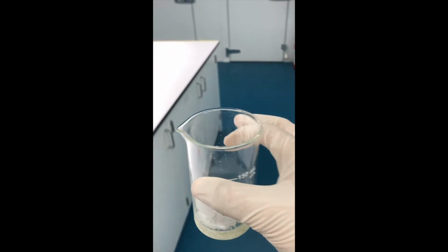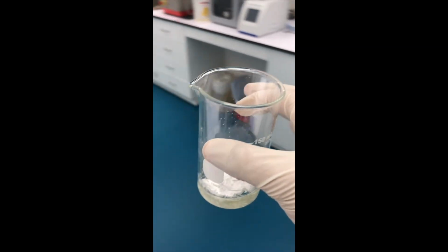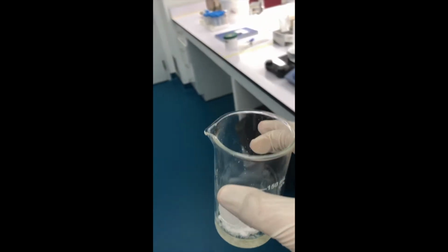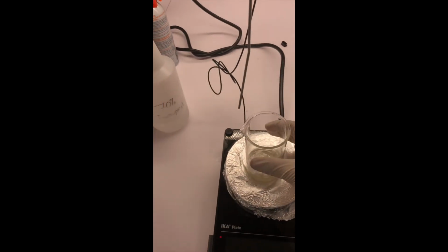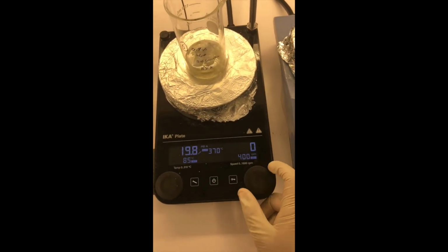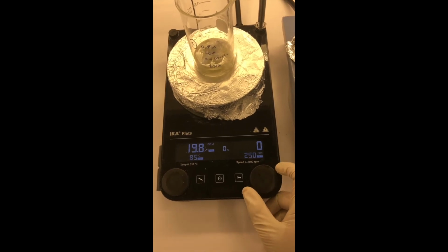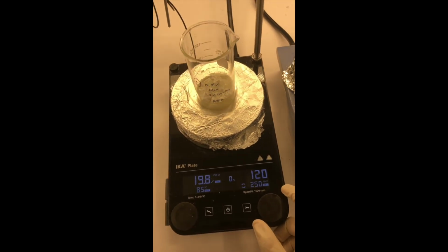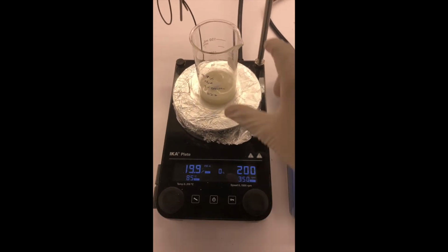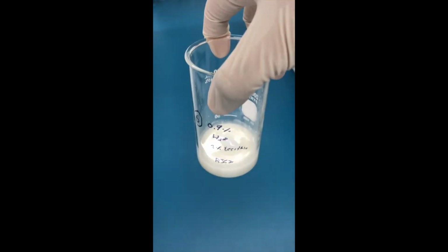And then finally now we can start to take this and get it all mixed up. And so here I'm basically walking down the lab towards the area where we contain all the stir plates or hot plates. And so I'm just going to set it down. I'm then going to turn it on and basically set the appropriate RPM that I want to mix my sample at. And here I also labeled the beaker. And so basically what this does is there's a magnet in the plate and the stir bar will mix. So then once everything is all mixed, I think after 30 minutes, I can safely take it off and then begin to add my water.